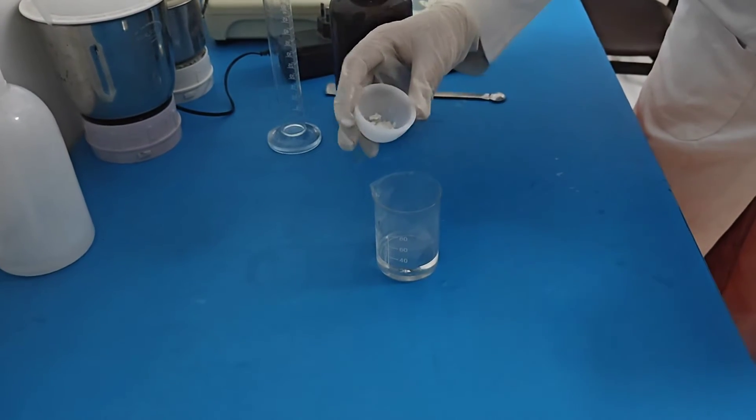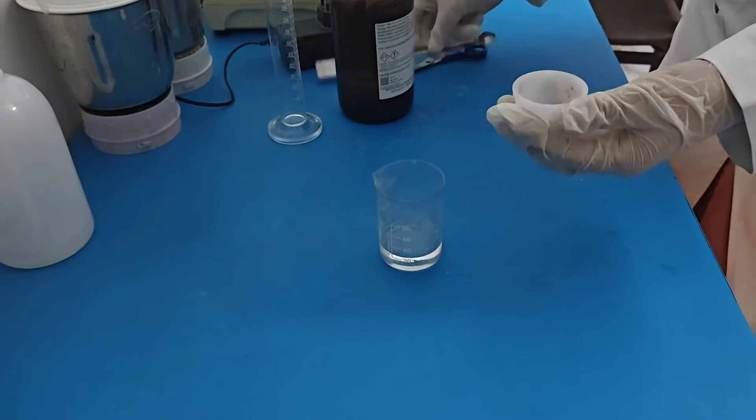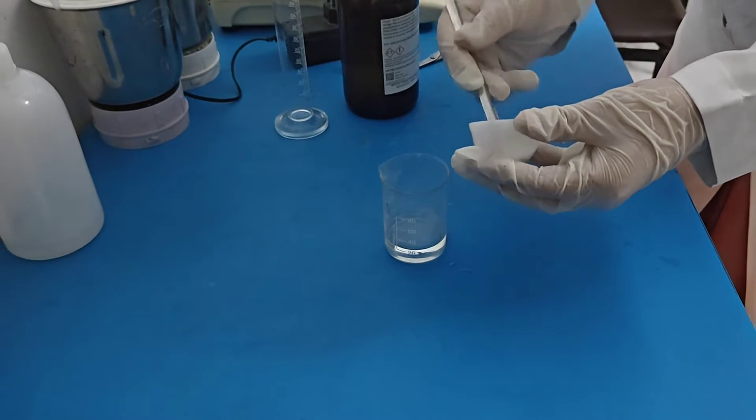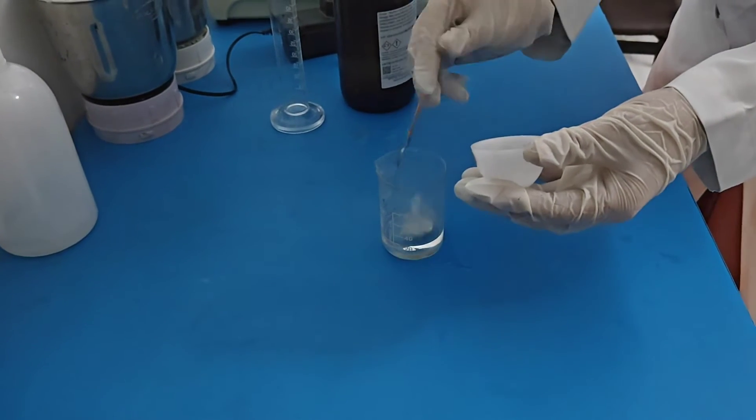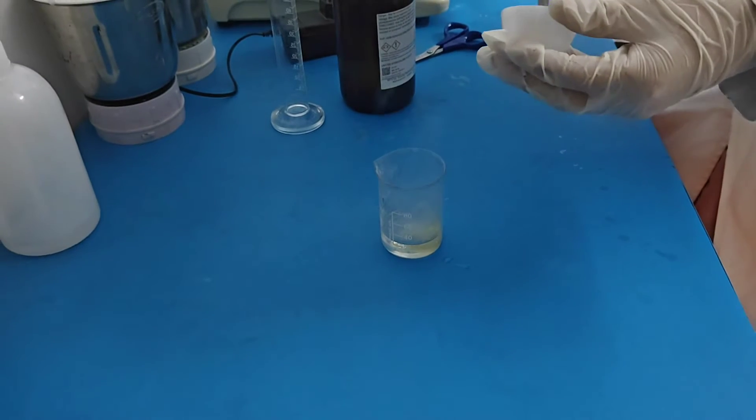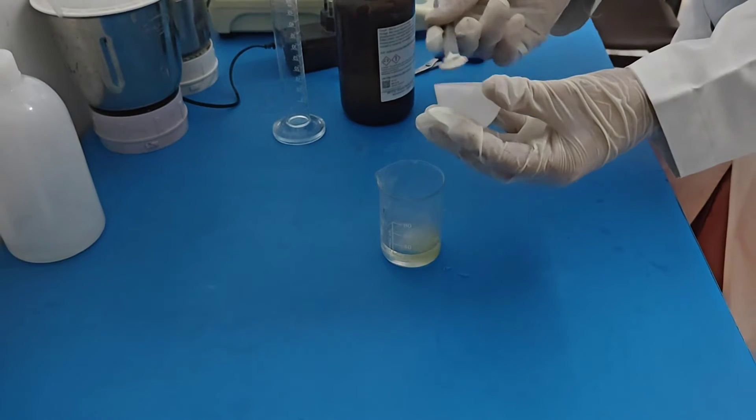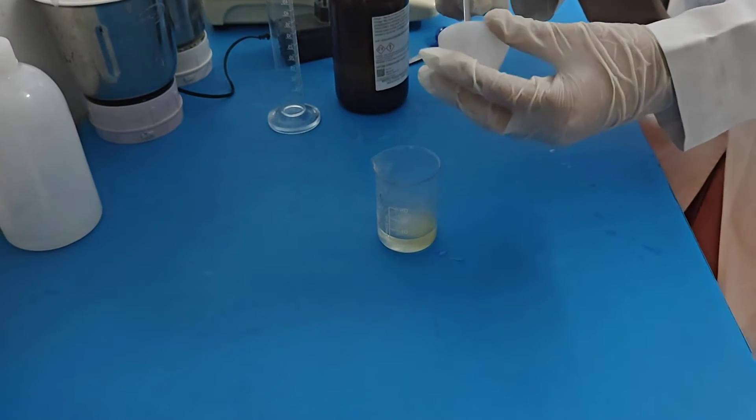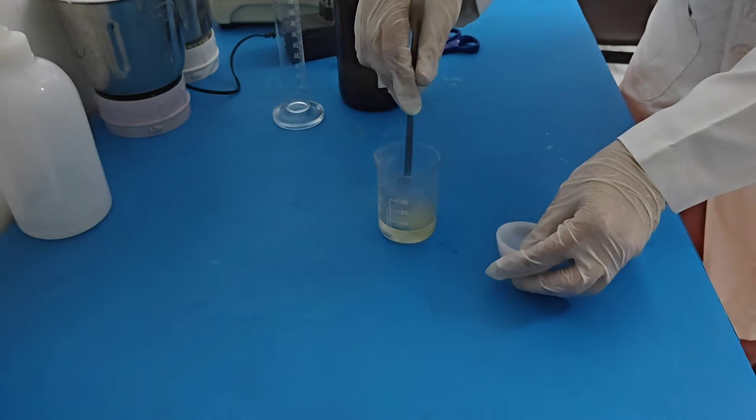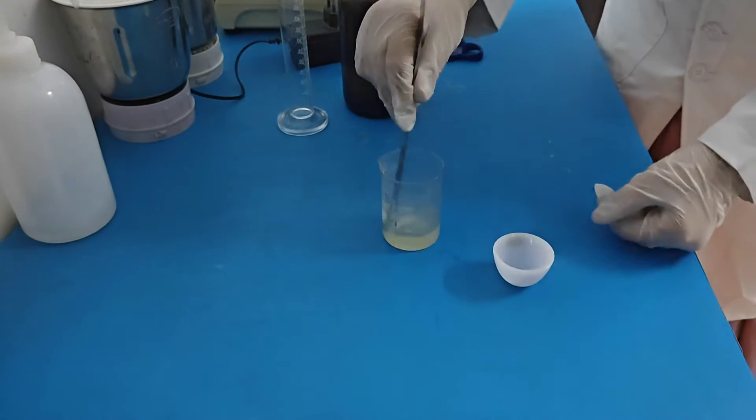Now I am going to dissolve the ash with the help of spatula. All the soluble ash dissolved inside the acid and the remaining is insoluble.